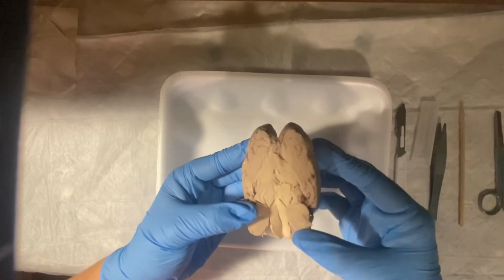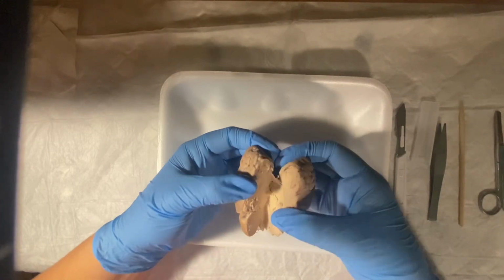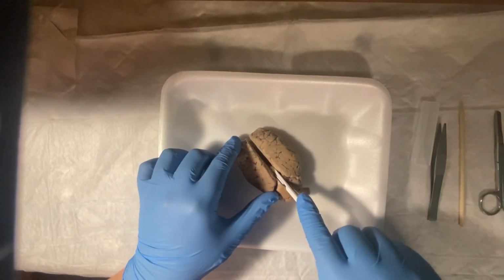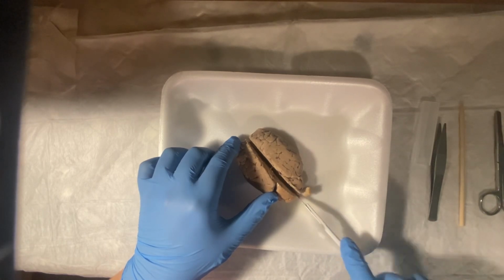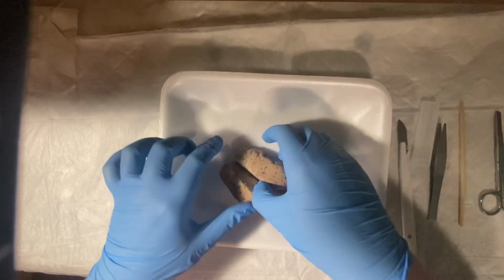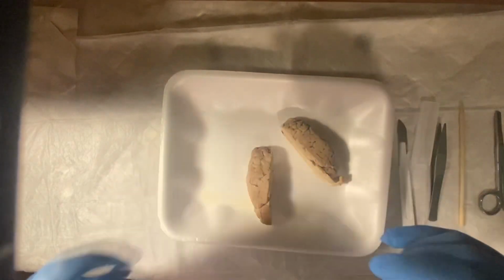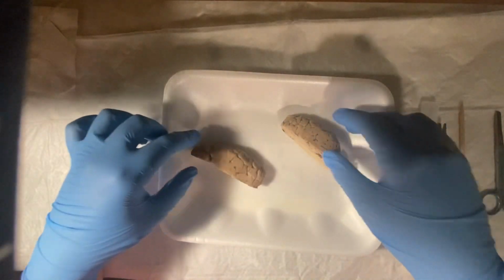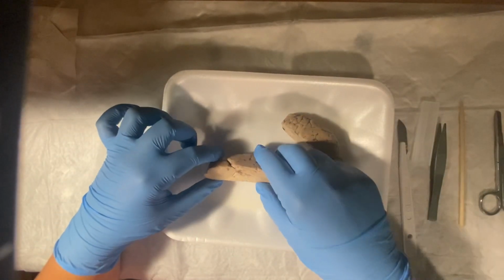There we go. Okay, and that was pretty easy.